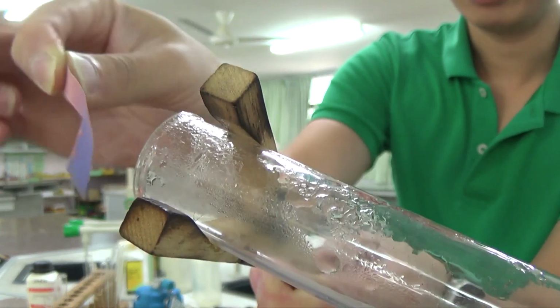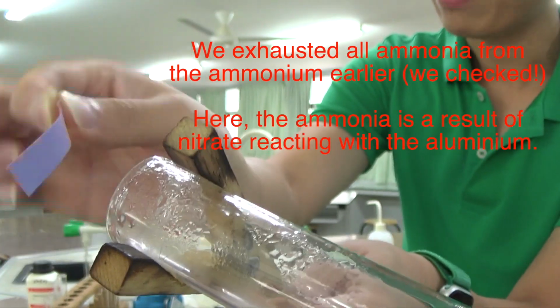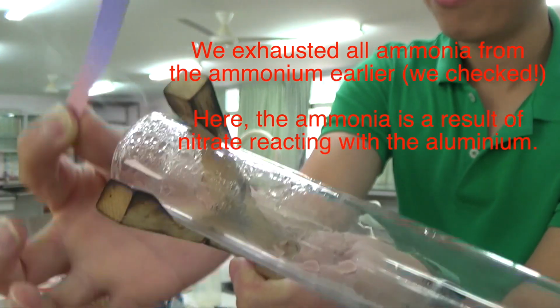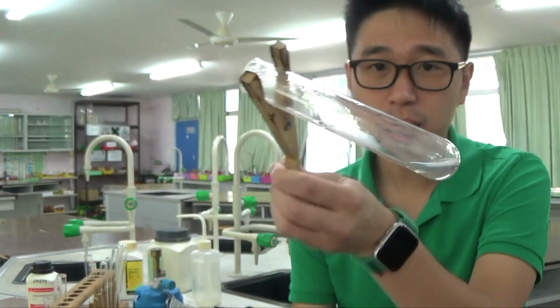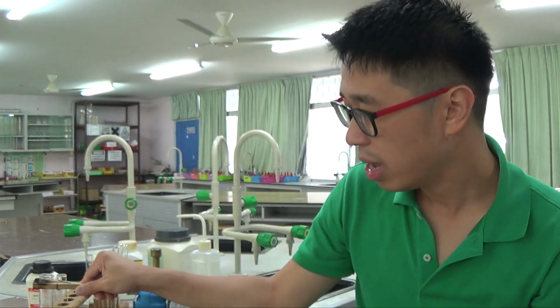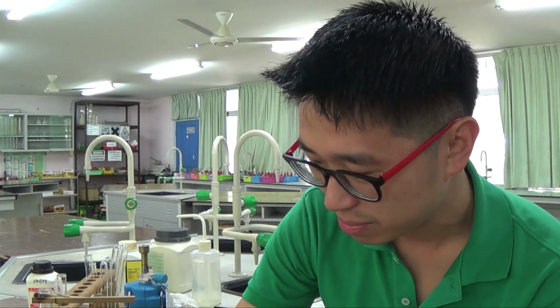There you go. You see how the red litmus paper is turned blue? Just now there was no more ammonia given off because all the ammonium ion has reacted, but now I get ammonia given off because I've just added aluminium to the solution, and the aluminium foil together with the remaining nitrate NO3 minus ion can undergo a further reaction to give you more ammonia, and it's pretty pungent smelling. Yeah. So then there's the second test.